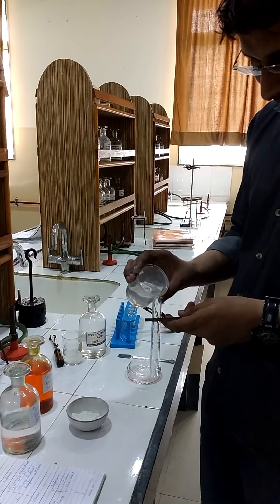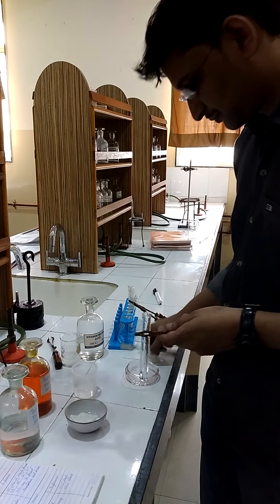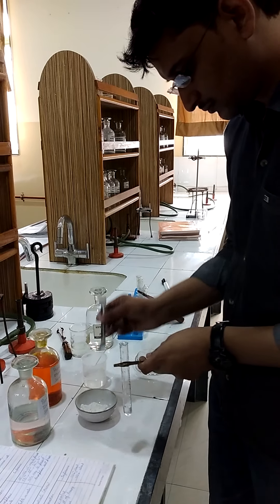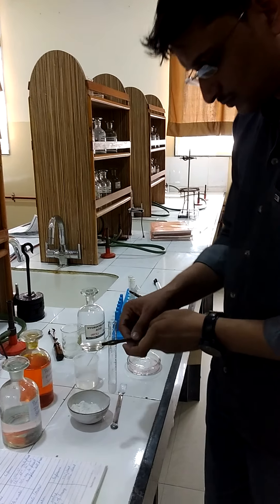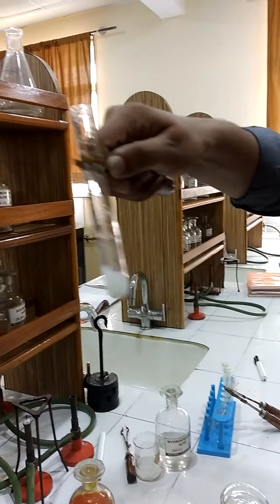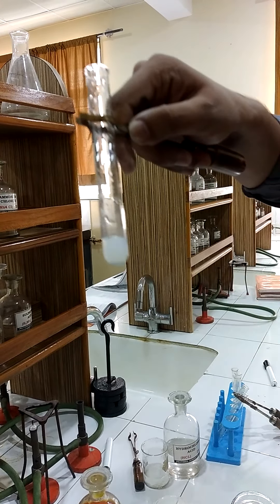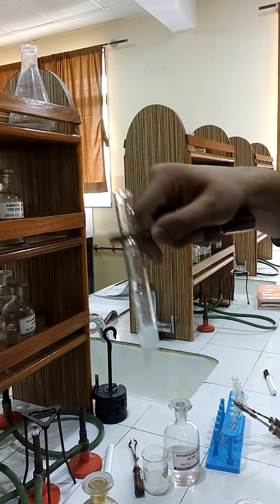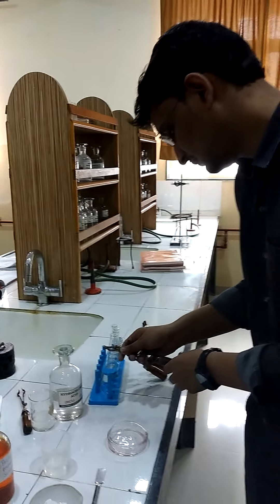We will take water. Here you can see that this is sparingly soluble, not fully soluble. Now we have got a solution.